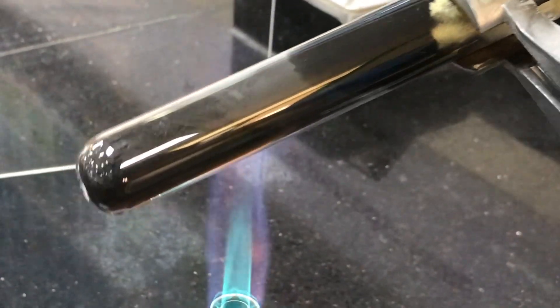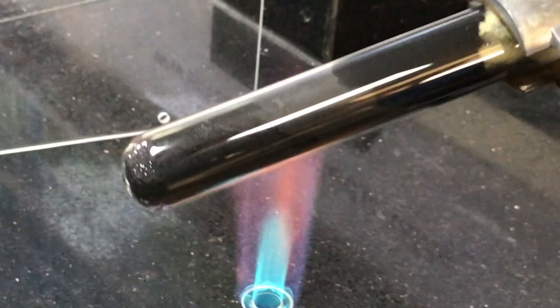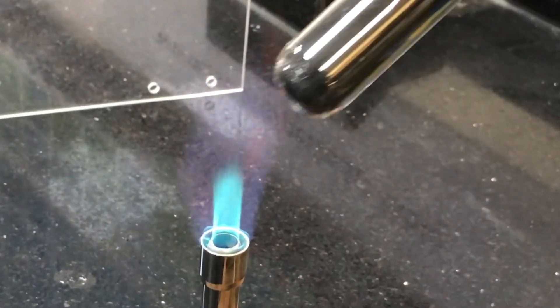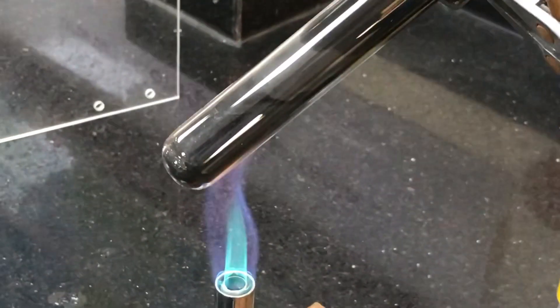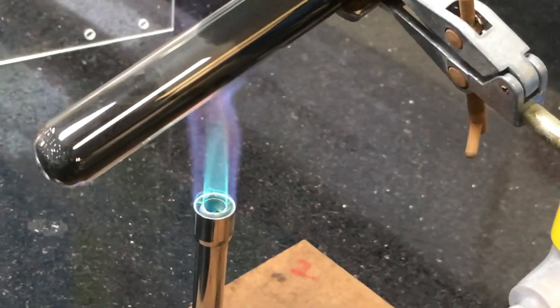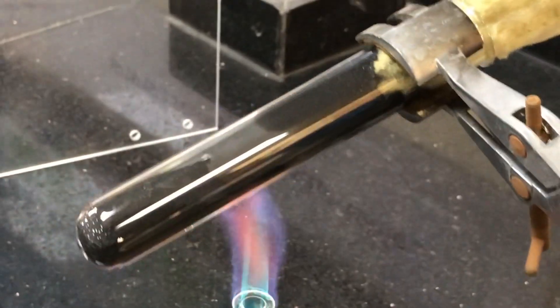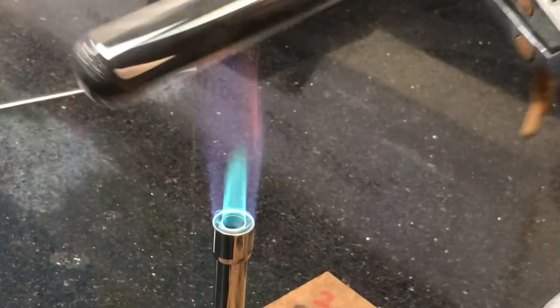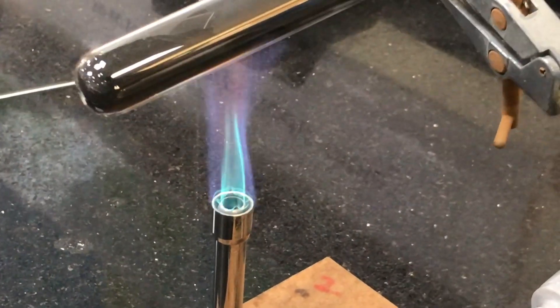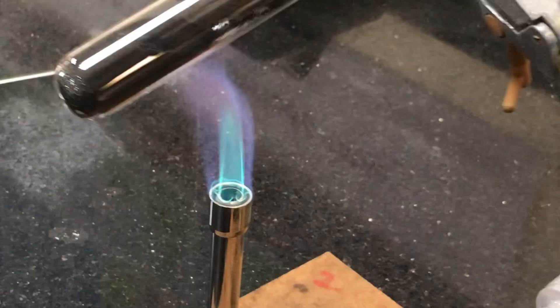Now you will get this moisture condensing at the top, don't worry about that, that is just absorbed within the charcoal while it's been stored, and just continue heating. When you try this out it might be worth testing it out to see if you get different results heating from the top to the bottom and bottom to the top. Perhaps if you heat it from the top over here to the bottom you might actually reduce the amount of pressure build up.